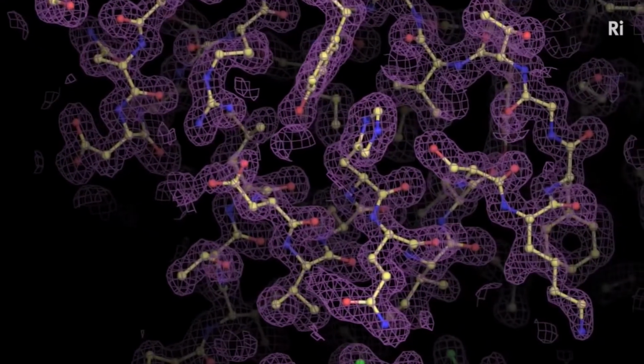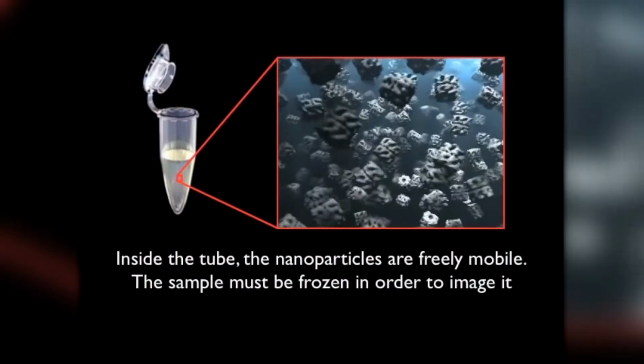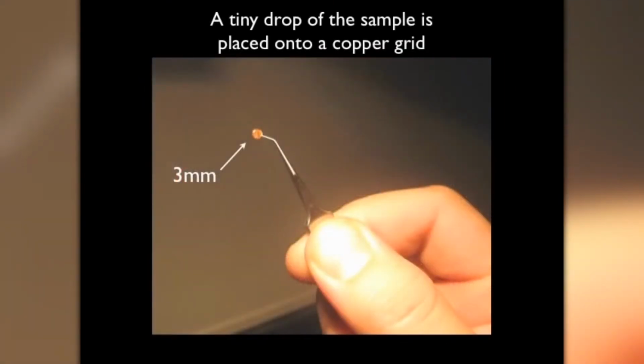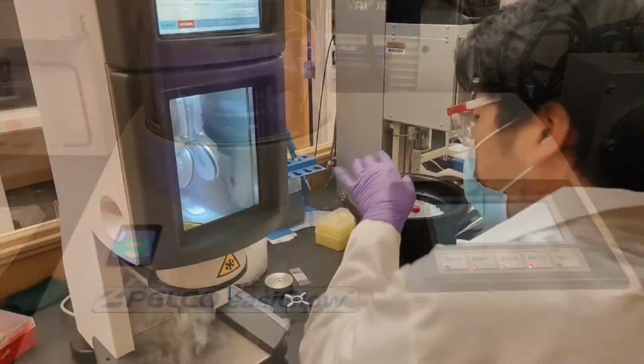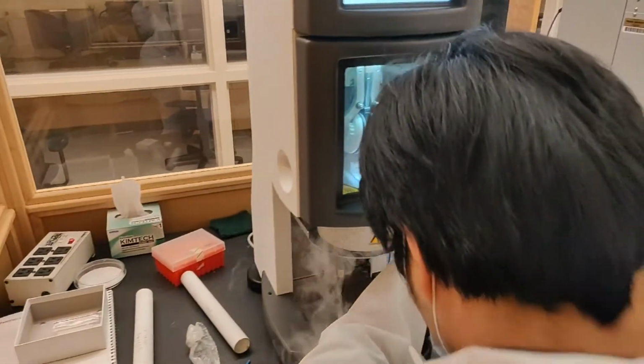Another emerging technique for determining protein structures is cryo-electron microscopy, or cryo-EM for short. Here, we do not need to crystallize our protein of interest, but instead dispense our protein onto tiny grids. We can then either stain the grid for negative stain electron microscopy, or plunge freeze it using this instrument to prepare the sample for cryo-EM.